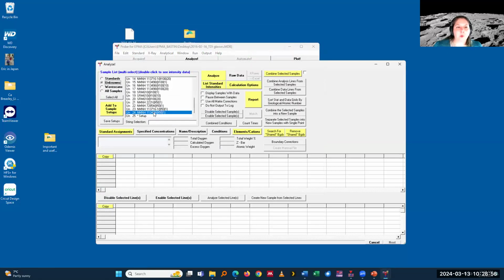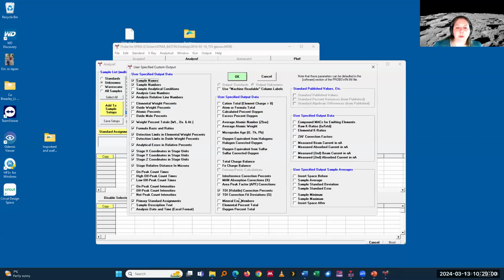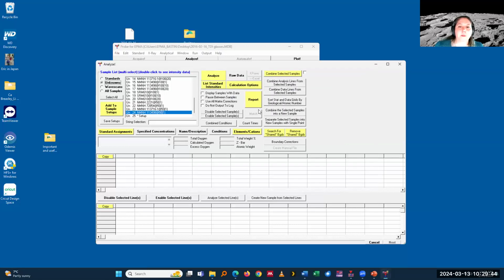And then in addition, when you export the data, there is the possibility in specified custom output to choose what you want to export. There is TDI correction percents and TDI fit deviations. I always, at least for myself, export that as well, because I just want to make sure that I was consistent with it and didn't forget something, but also it's sometimes easy to see if there's a total outlier, and then maybe go back to that specific entry and see, is that actually meaningful, did I do the correct thing, or should I have used a different fit or whatnot?